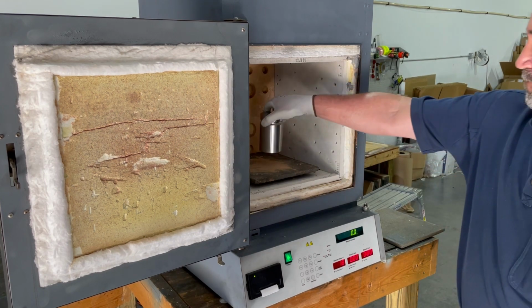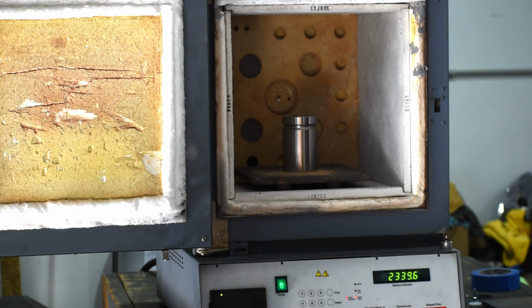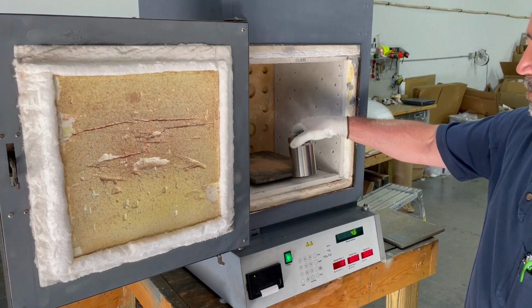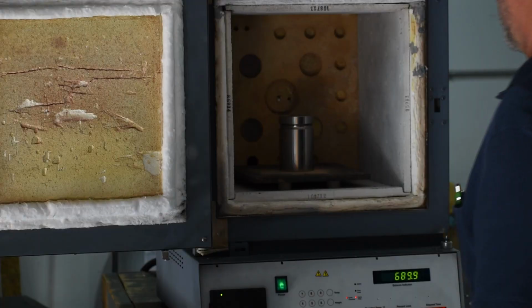This means that when you apply a 4,000 gram known weight, your NCAT will read 4,000 grams, or at least an acceptable tolerance level. Now let's move the hearth plate back a little and see what that does to our readings.